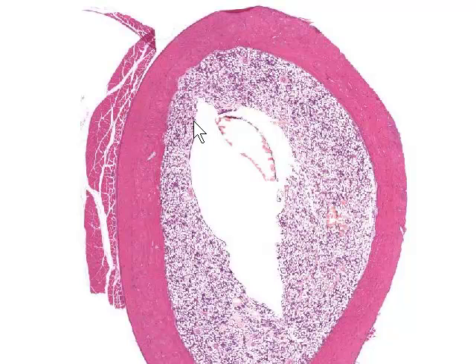And then finally, one other thing that I would like to remind you and remind me to take a look at is the connective tissue membrane that lines the outer surface of the bone here, called the periosteum, and the connective tissue membrane that lines the inner surface of the bone here, called the endosteum. Now let's increase in magnification a little and take a look at the bone itself.